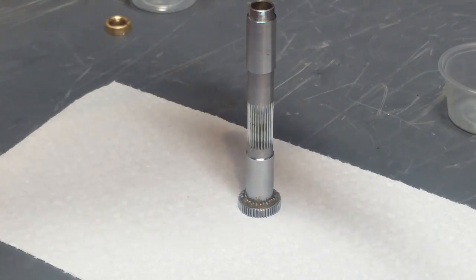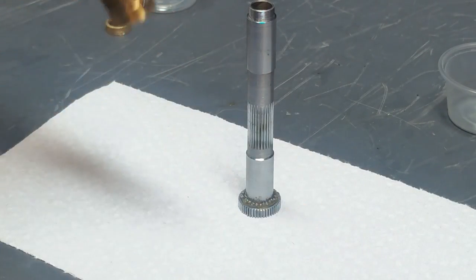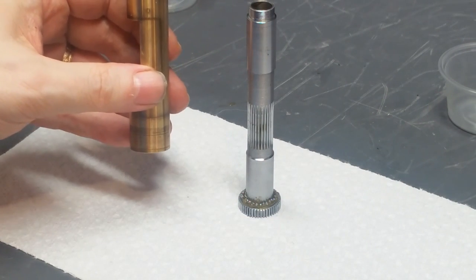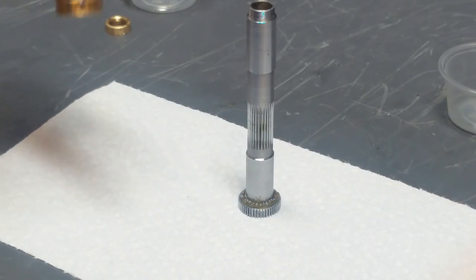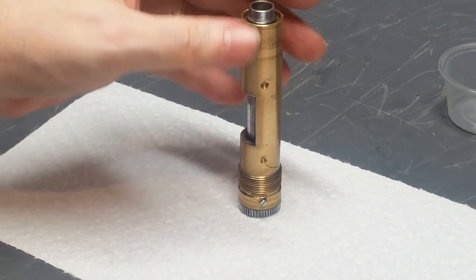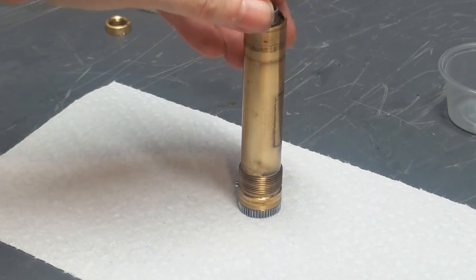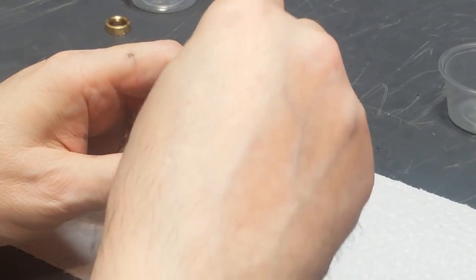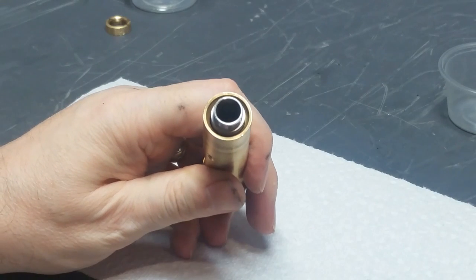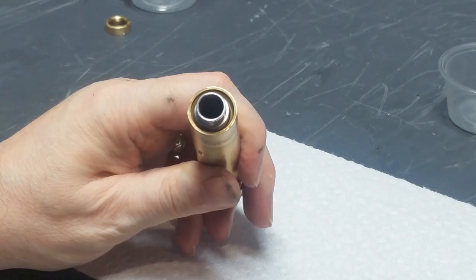Now what we do, take this thing thoroughly cleaned, make sure that this screw is facing down. You don't want to put it on that way. I've done that before and it's really frustrating because then you have to take the whole thing apart. So make sure the screw is down, lower it on here carefully until it's laying on those bearings. A little grease might come out, that's okay. So now the next step is to pick this up, hold this so that it doesn't come out, and apply a bead of Plastilube grease all the way around in that opening there.